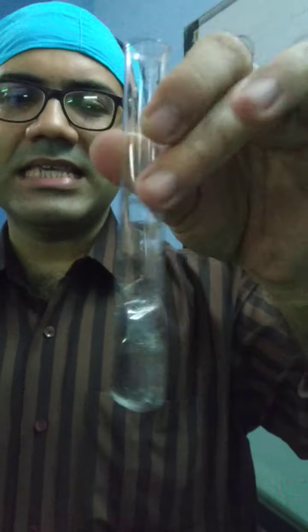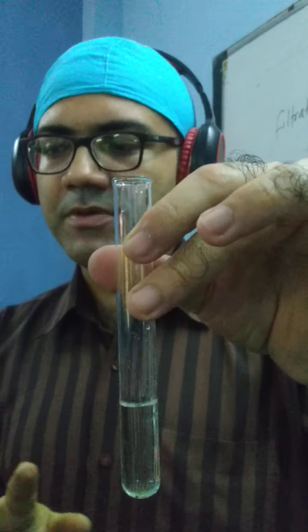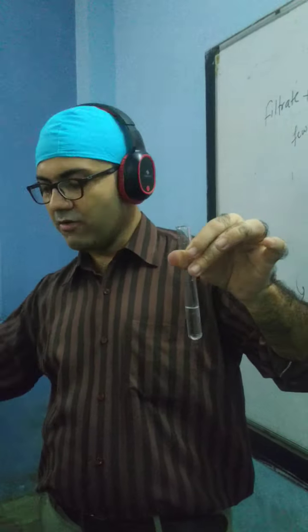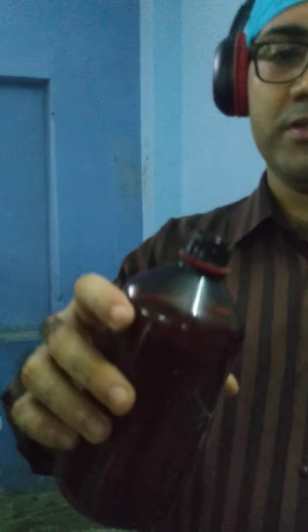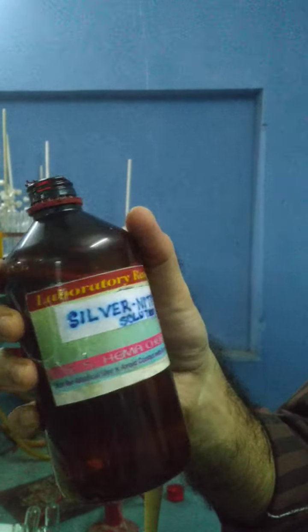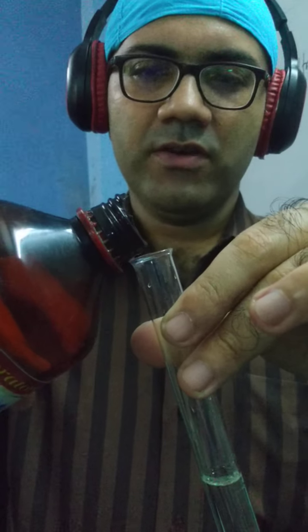So that means this is the indication. No more effervescence with one drop of dilute acid. Effervescence is not taking place. That means neutralized. To this neutralized solution, I will add silver nitrate, and expecting if chloride is present, I should get a white precipitate. Silver nitrate, you can see over here it's written silver nitrate solution. Don't focus on the spelling, it's a slight typing error. So let me add a little bit of silver nitrate.